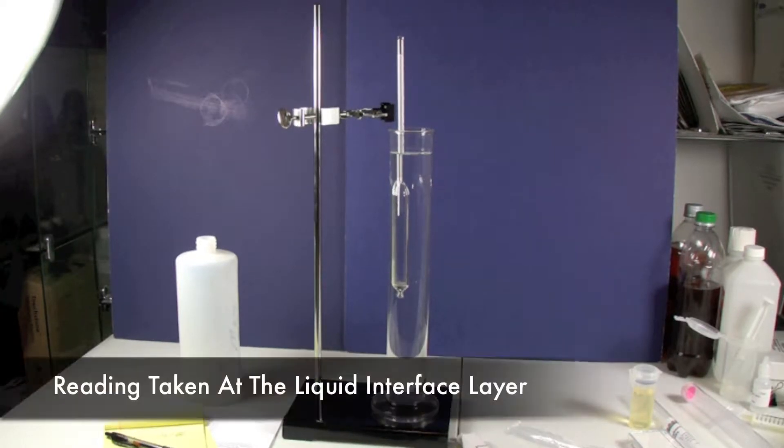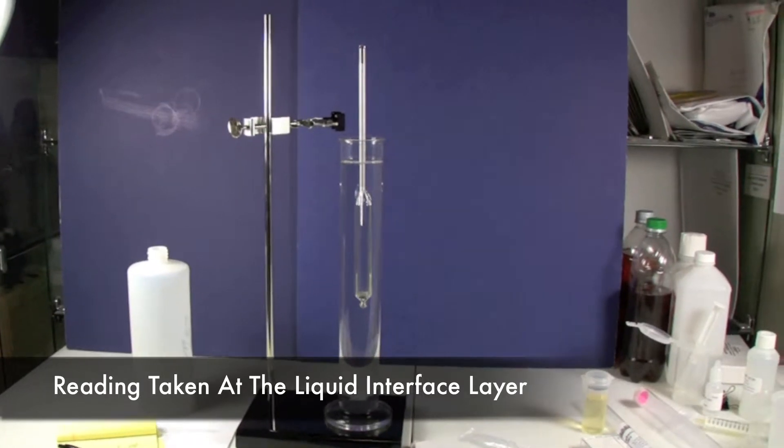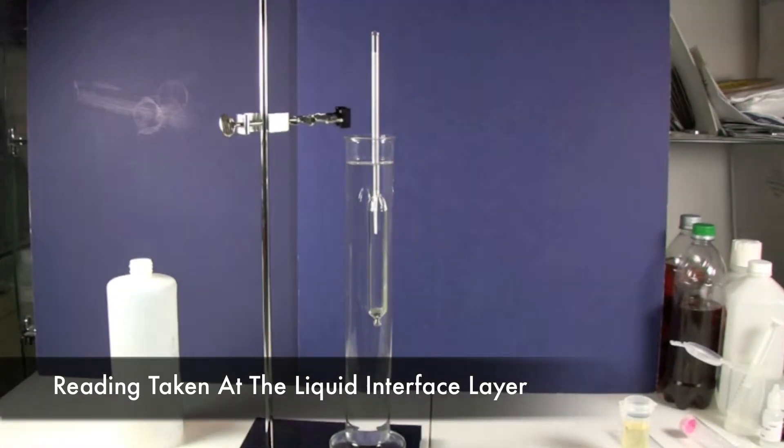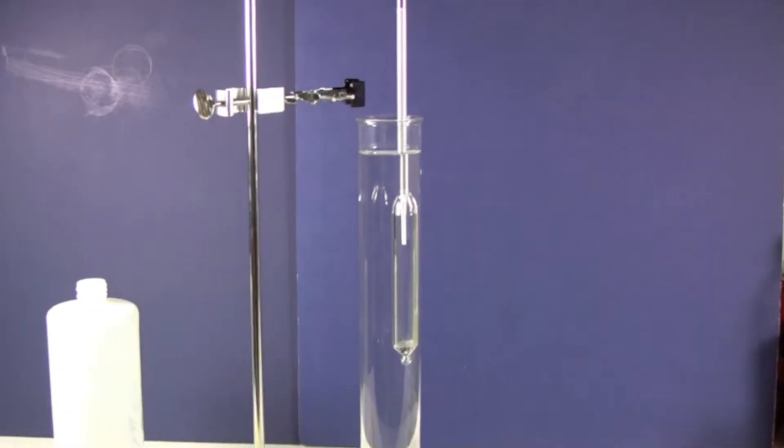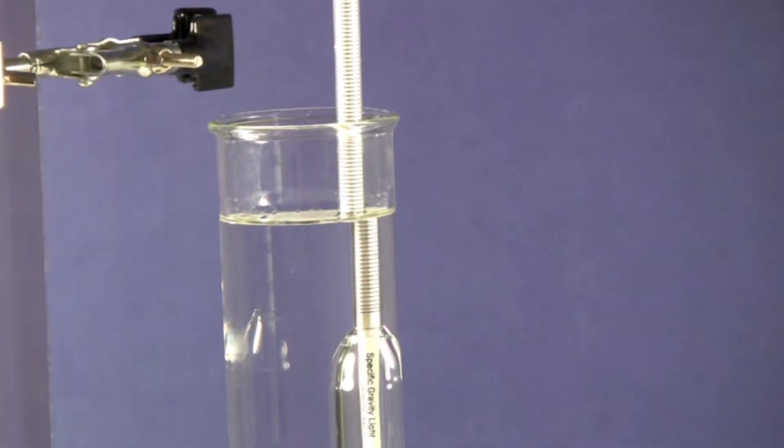The reading will be taken right where the hydrometer interfaces with the liquid. So at the top. So in this case, right here.